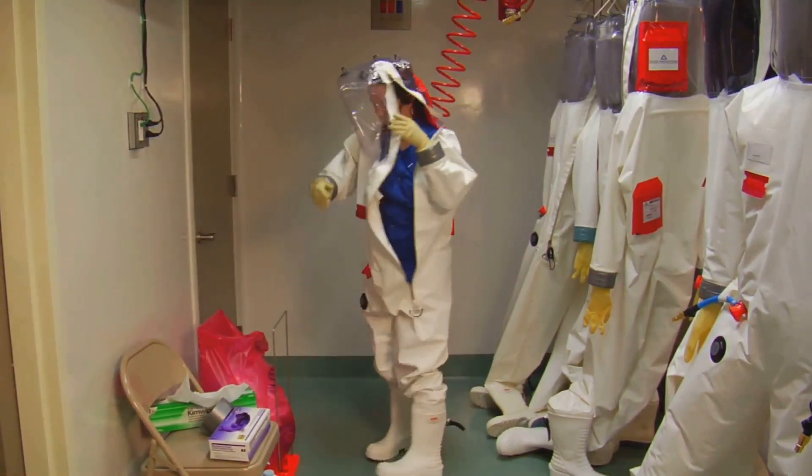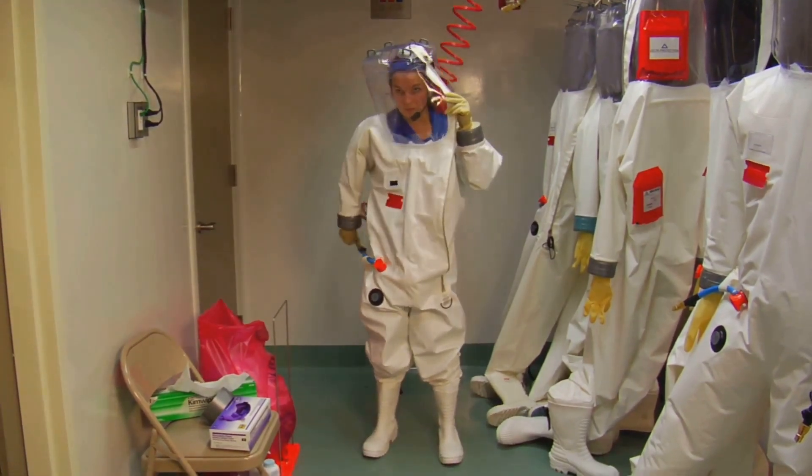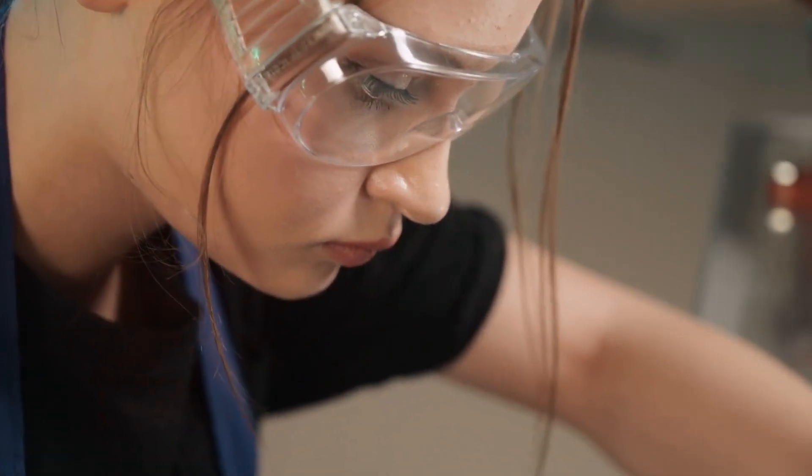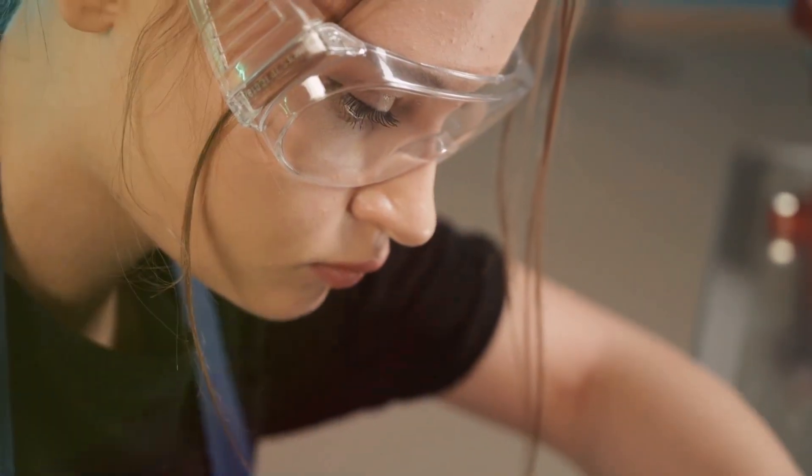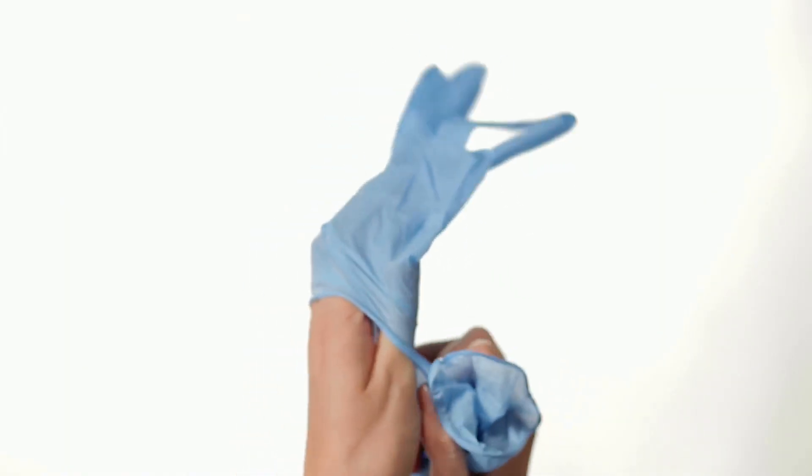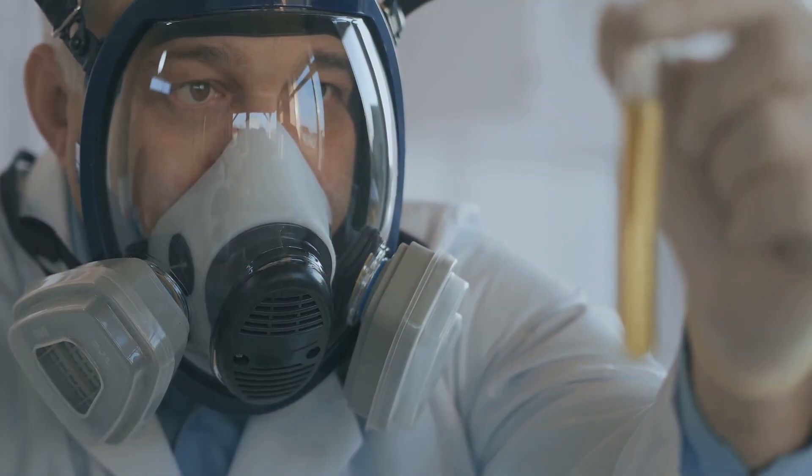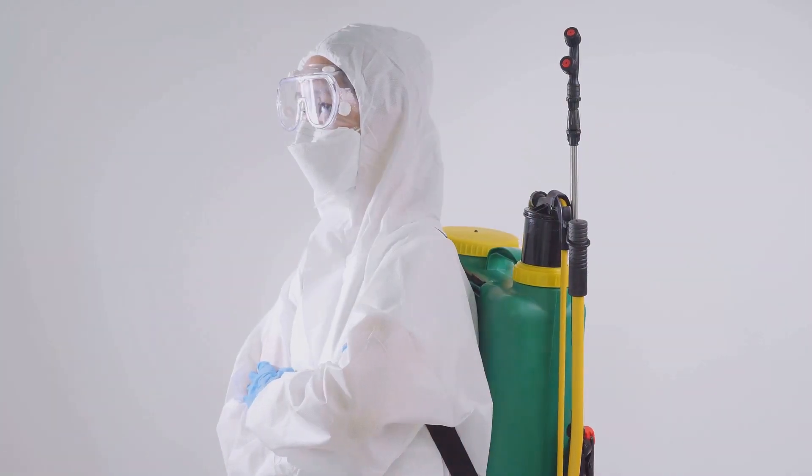So before we even think about touching those electronics, let's suit up like the responsible scientists we are. First and foremost, we need a pair of sturdy safety goggles to protect our eyes from splashes. Next, slip on some thick chemical-resistant gloves to shield our hands, and don't forget a respirator mask to prevent inhaling any harmful fumes. Trust me, your lungs will thank you later.